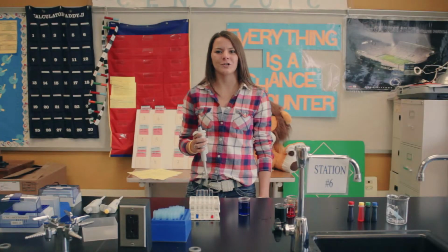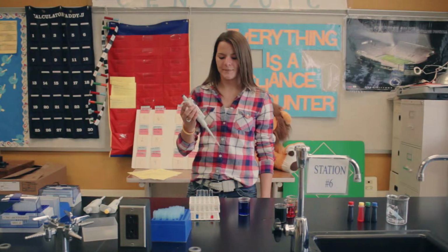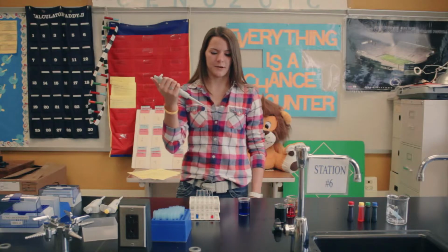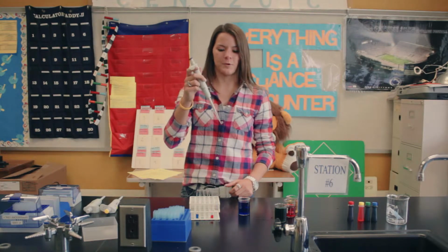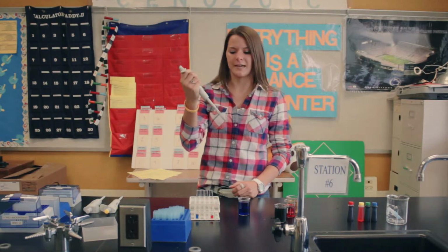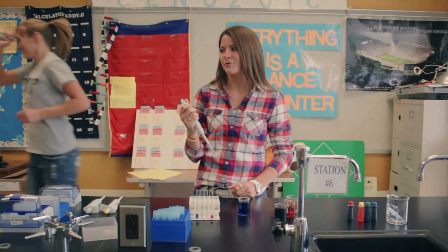I'm Carrie, and I'm going to show you what not to do with micropipettes. Whenever you dispense liquid, sometimes you'll have little air bubbles or droplets of water inside. Never lay it down on its side or hold it upside down because you can damage the micropipette and then you have to buy it yourself.